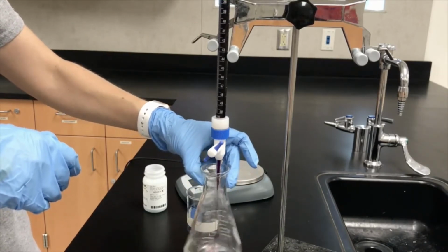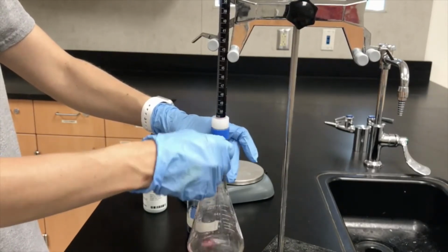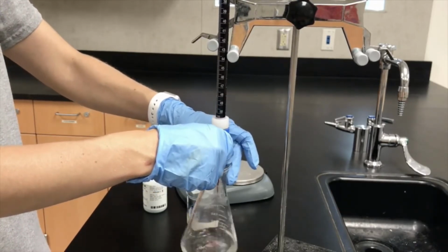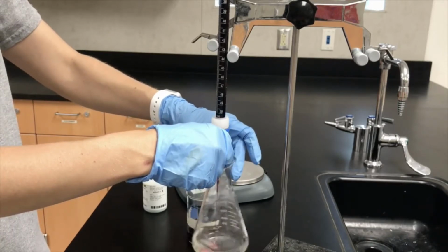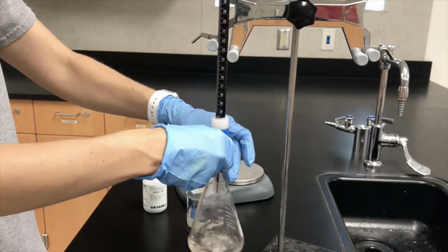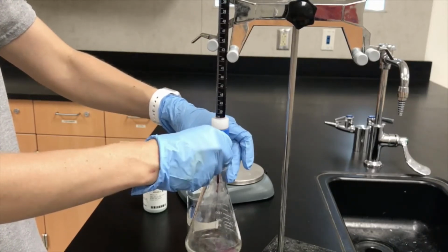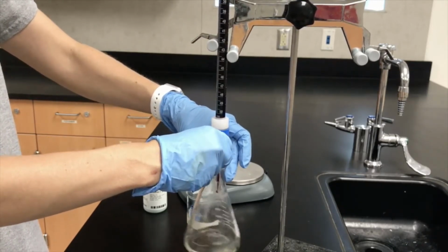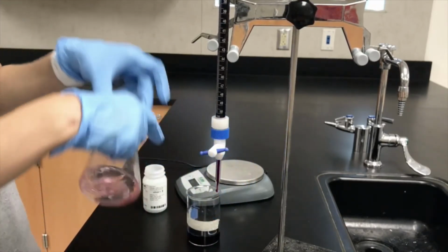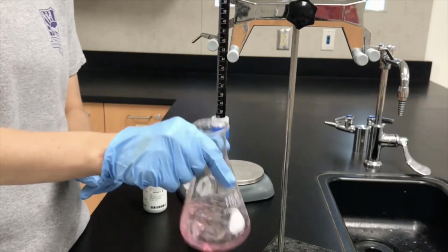Okay, so it could be going for a while. Keep swirling. One person could be in charge of the stopcock, one person in charge of the swirling. I do it all myself, but make sure that everyone gets experience with this. Notice it's starting to linger a little bit, so I might add it a little bit slower. Okay, I'm going to really try and do dropwise now. Whoop, whoop, whoop. See how quickly it changes? Okay, so I got that light pink color. I slightly overshot it. You want it as close to clear as possible and only a tiny hint of pink.